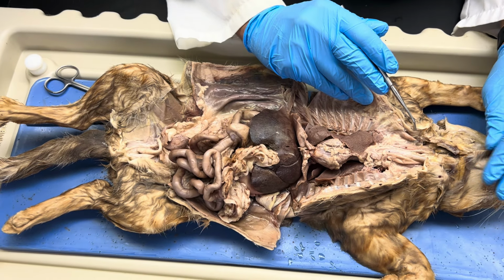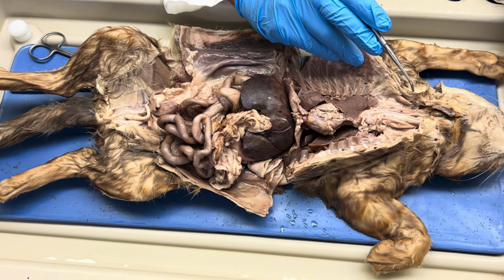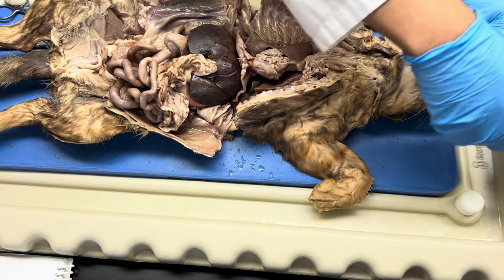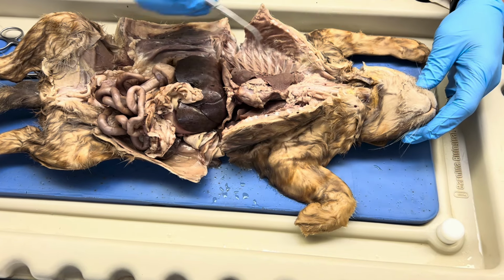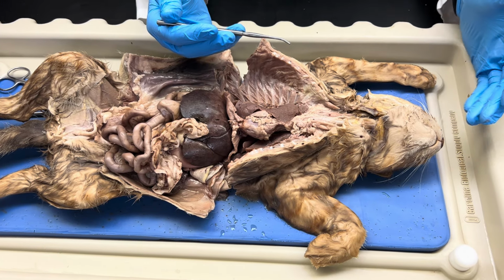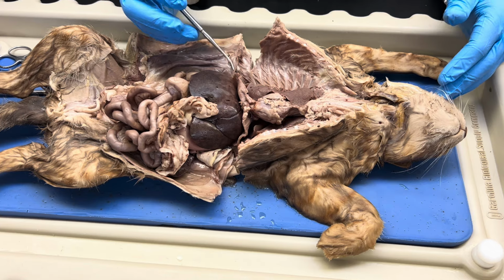All right, so I'll just try to take it structure by structure the way it is in the list. It's pretty straightforward. First, you have the oral cavity, or the mouth, obviously. I mean, that shouldn't be a hard thing. The tongue is also there, but this tongue isn't protruding. It is hit or miss. Nobody's trying to break his jaw to pull out a tongue, all right? I'm gonna be honest with you. But you do have tongue on that structures list.